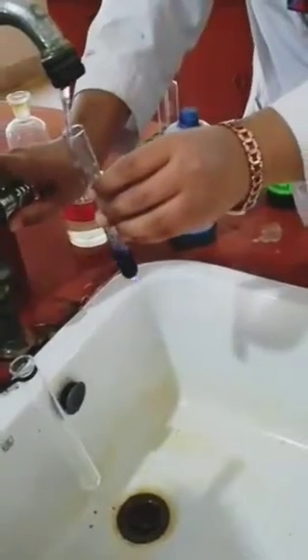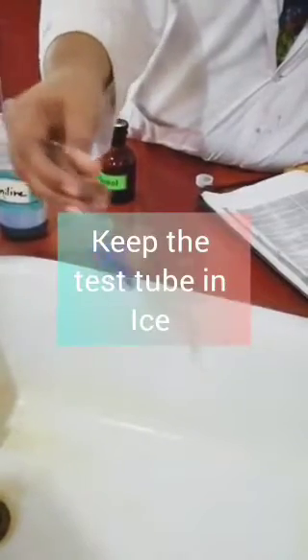After the addition of hydrochloric acid, I'm going to add approximately 4 ml of water. We have to be very conscious of the ratios we are using. Shake the test tube well — as you can see on the screen, this is the proper way of shaking so that all the components are mixed together properly.